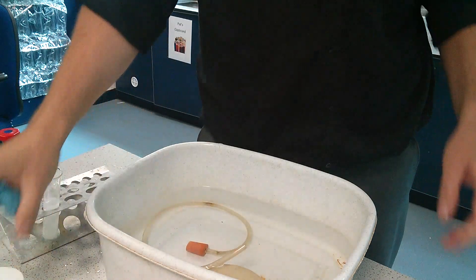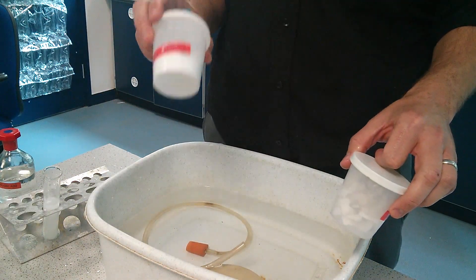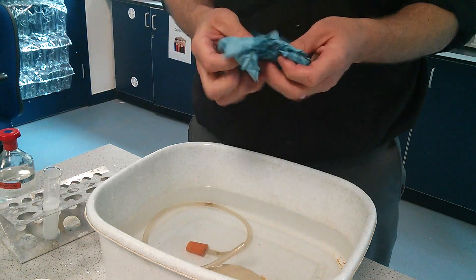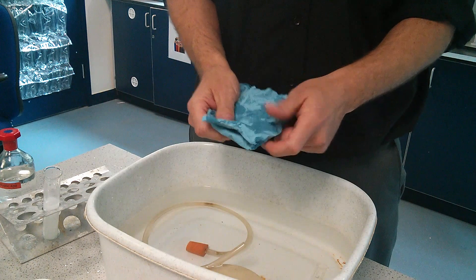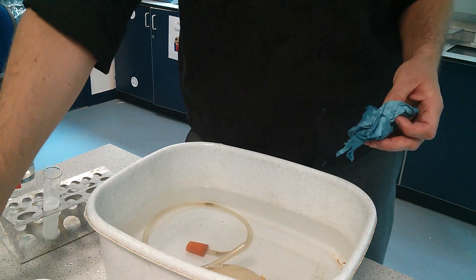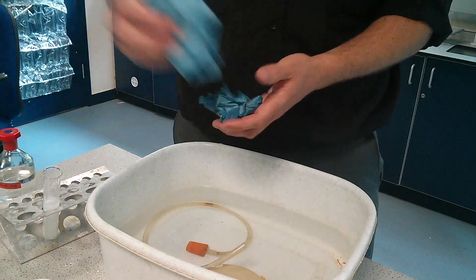The three sizes will be medium, large, and powder. With powder, you'll need a spatula and a piece of paper. Place the paper onto the scales, press to zero it, put your powder on, and pour it in.